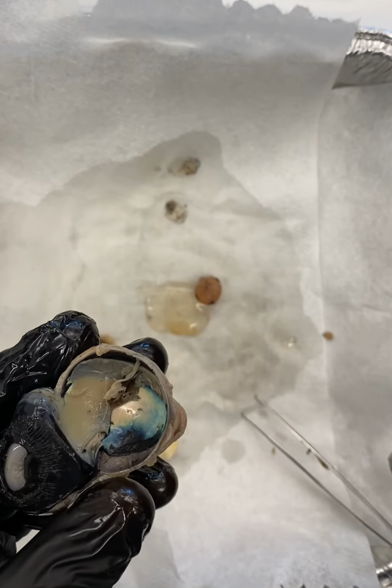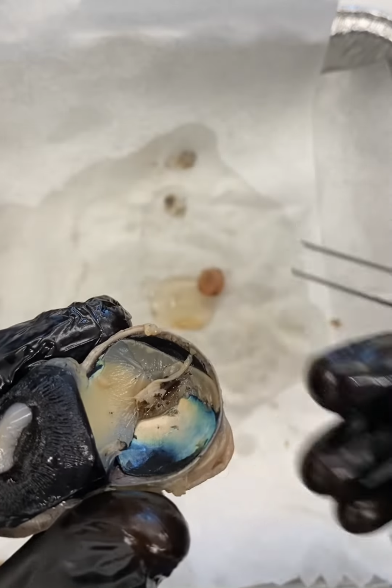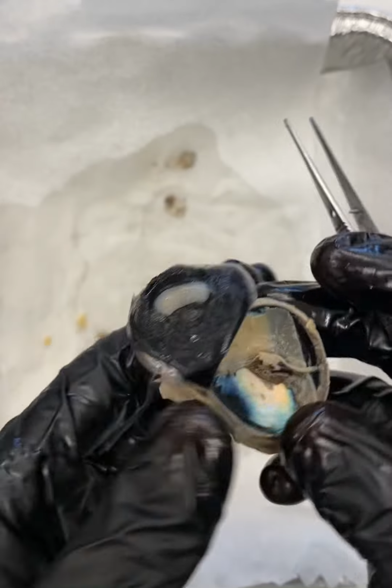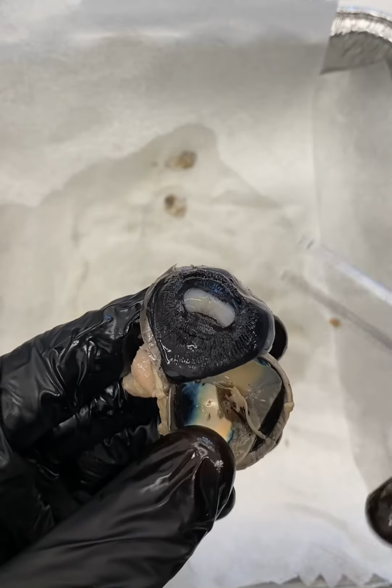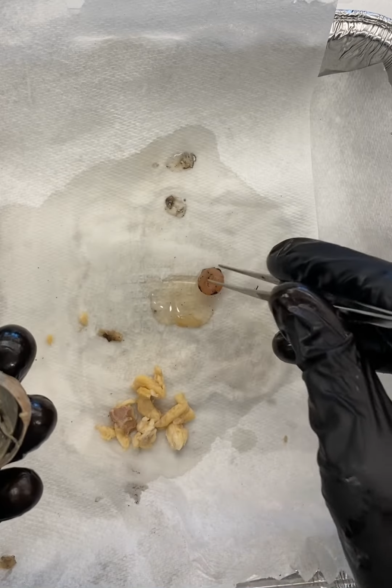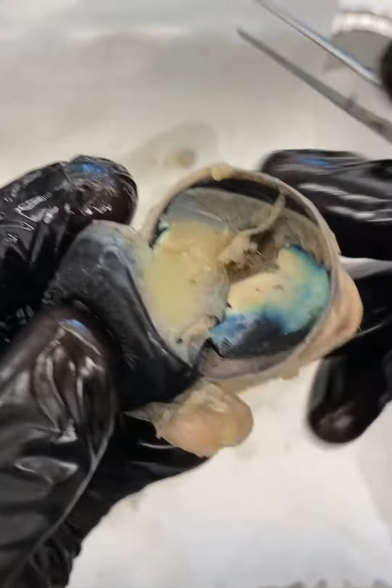Okay, everybody, welcome back. So this is going to be part 3, and this will likely be our final part for our eye dissection. If you recall, in part 1 we talked about the majority of the external part of the eye. In part 2, we got into parts of the pupil, parts of the iris, and parts of the ciliary body. We talked about the lens and vitreous humor. What we'll finish here is we're going to look at the back side of the eye.